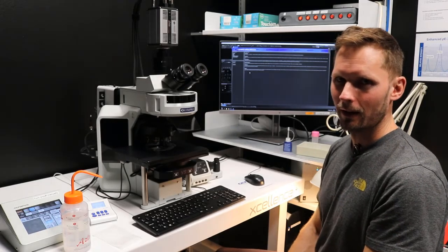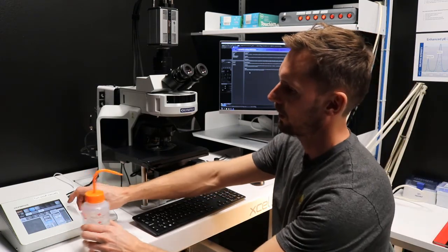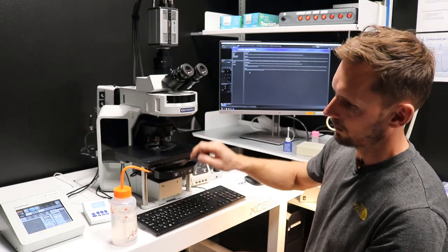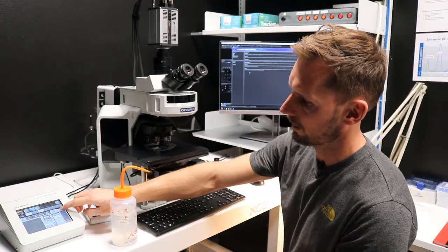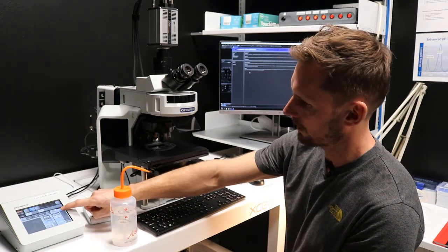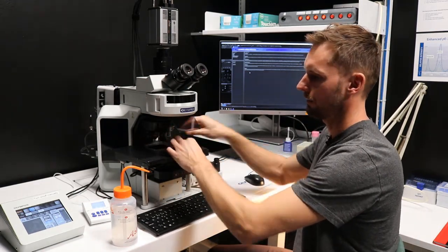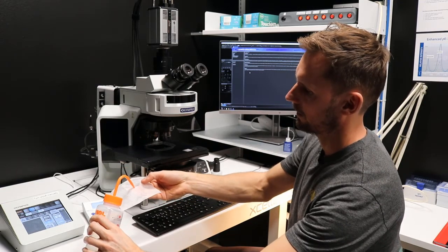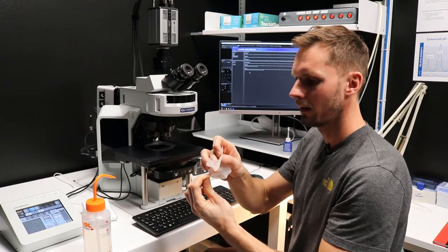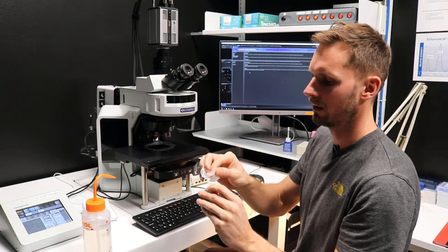So now we are done imaging, and we want to leave the system clean for the next user. So first of all, you go to escape position, and we need to take out the oil. So you can press this button to go all the way up, so you can have your working space cleaning the lens. Take out the sample, and with some ethanol here, you first clean the sample. Circular movements, of course, take care that you're not damaging your sample.